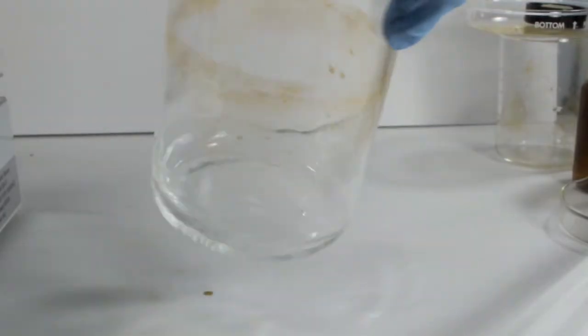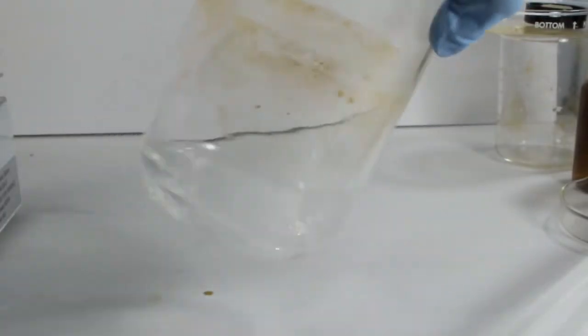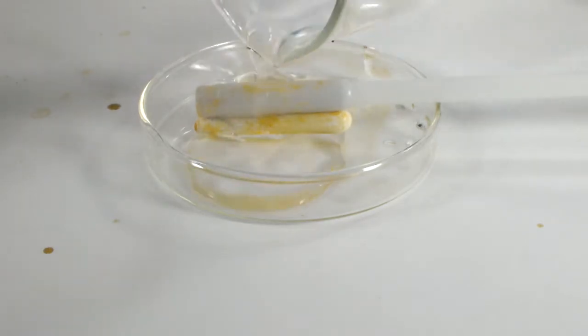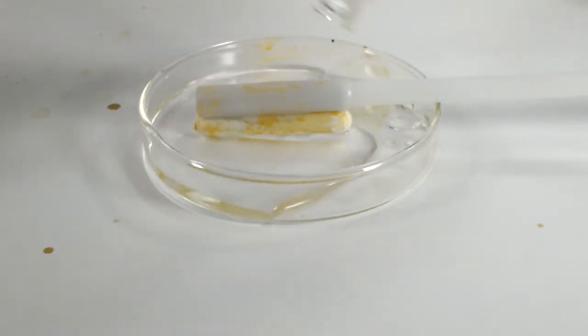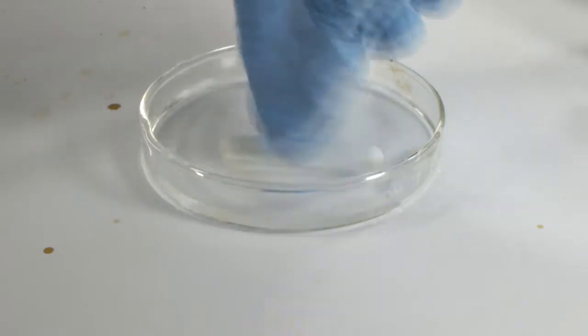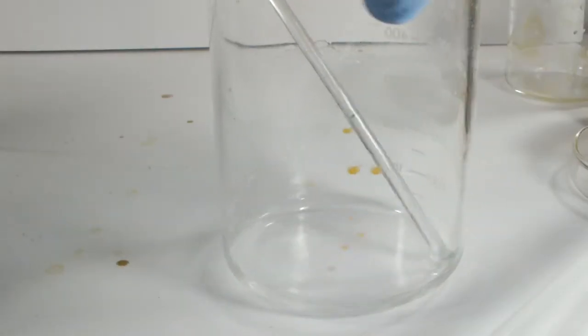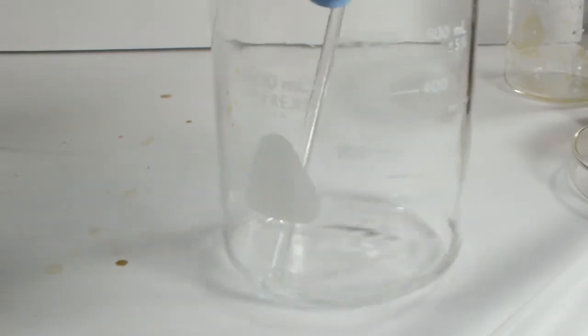It's actually easy to clean if you have the right solvent. A solution of sodium thiosulfate dissolves this stuff right up. This is the same beaker after a little work, and it's good as new, except for the stuff on the outside. I'll get that in a minute.